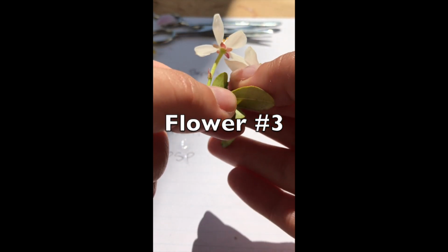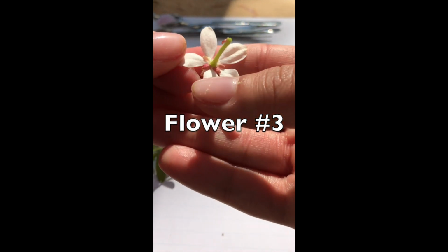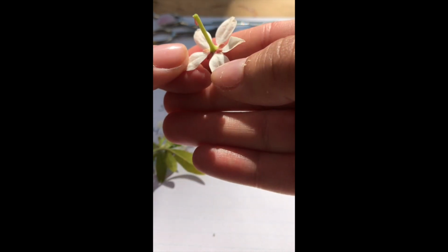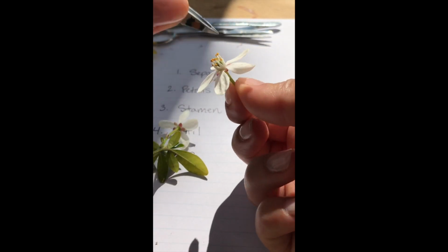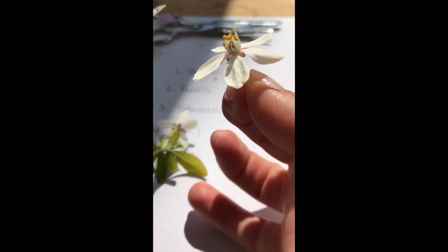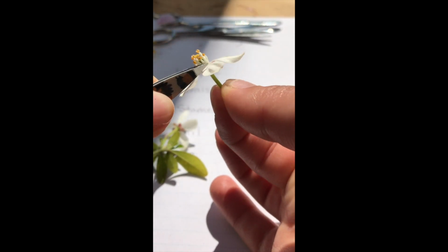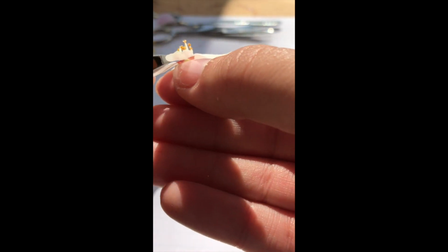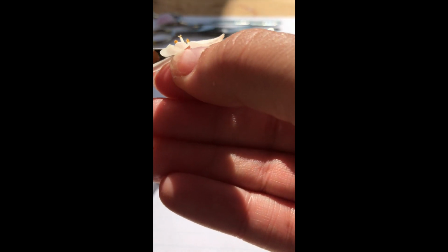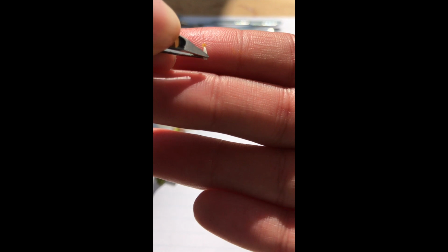This is another type of flower that, looking on the bottom, the sepals are actually really obvious. They almost look like a little pink star on the bottom of the petals. See that? Then the petals are the white ones. And you can see on this flower, the stamens are kind of short and chunky. They're little white bodies with little yellow heads. If I pull one off, that little yellow head is all the pollen.